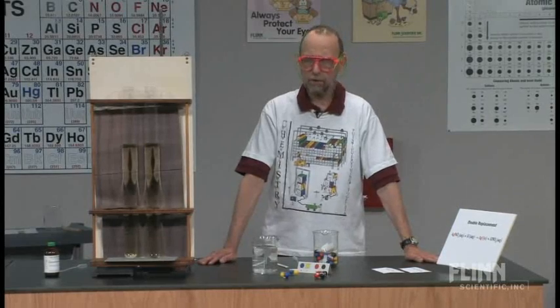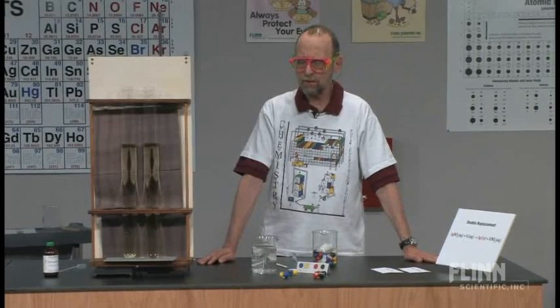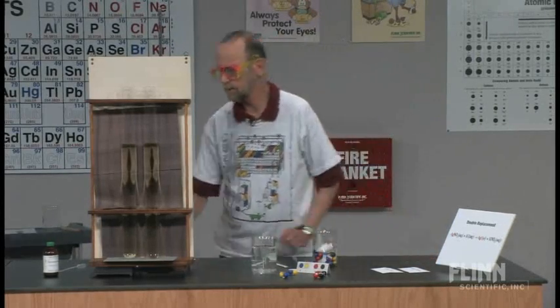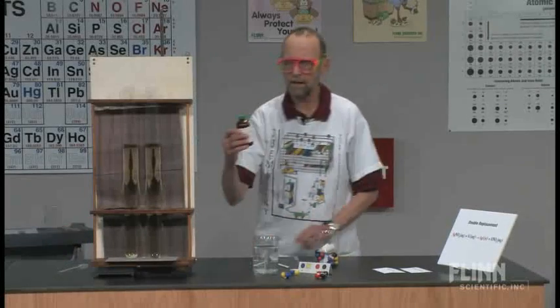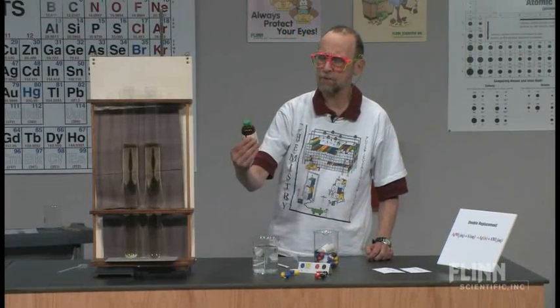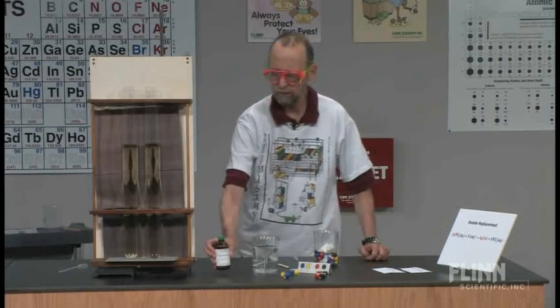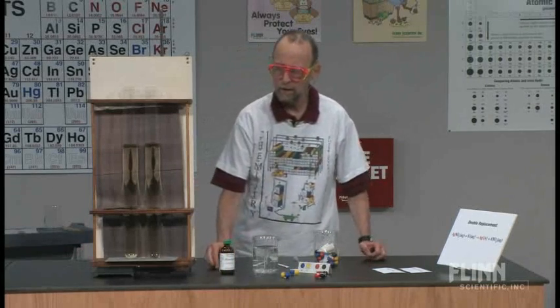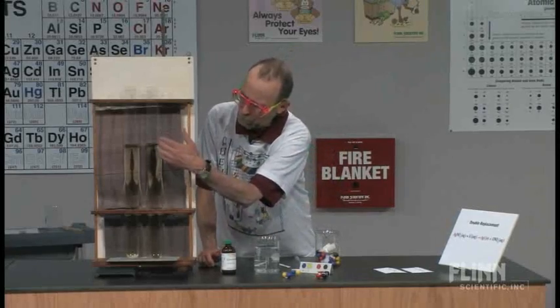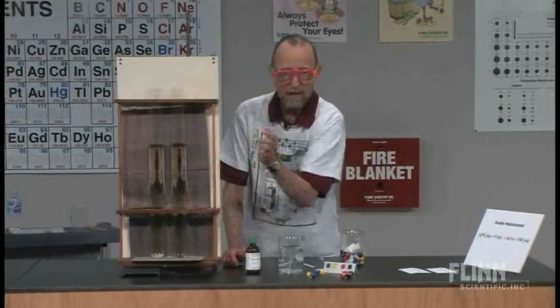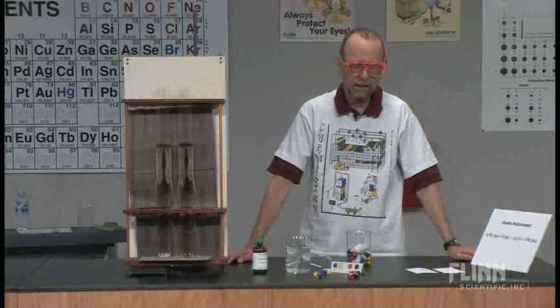The materials we're going to use are silver nitrate, which we have in this bottle right here, a silver nitrate solution. I think it's one tenth molar, not very concentrated, but we have some silver nitrate there. In this test tube, this big test tube, we have some potassium iodide, KI.